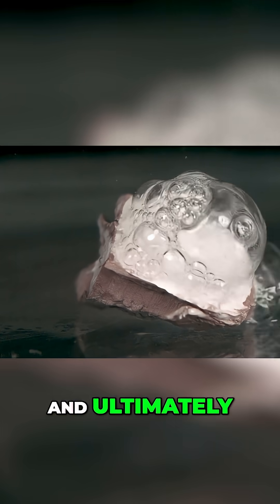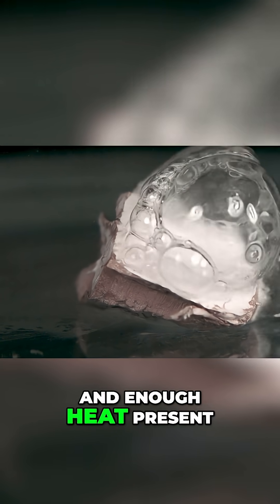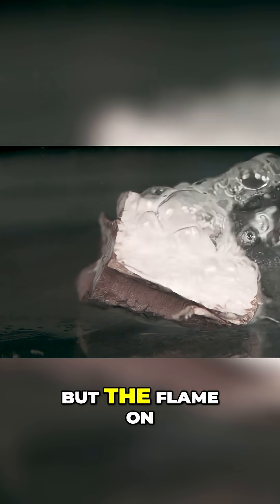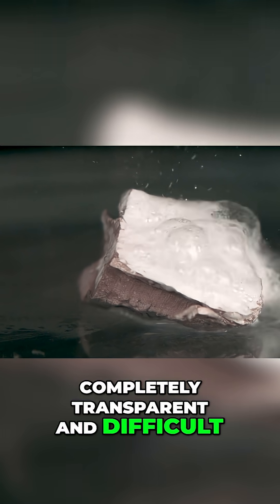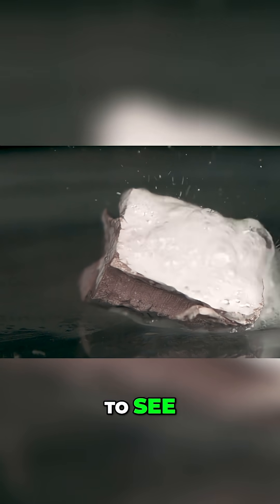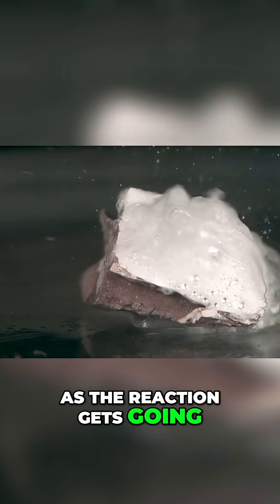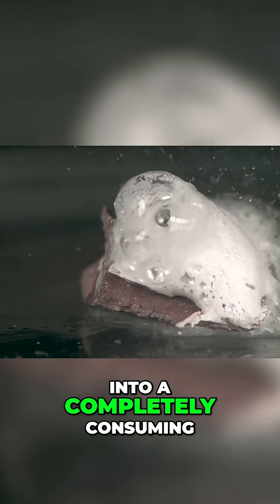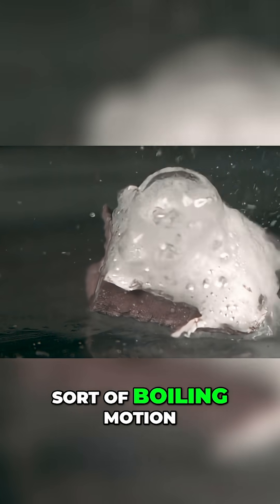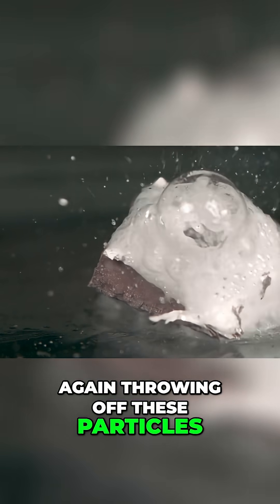And ultimately, this hydrogen will ignite if there's enough water and enough heat present. But the flame on the hydrogen is almost completely transparent and difficult to see. You can see that as the reaction gets going, first it's sort of like a gentle simmer, and then it turns into a completely consuming sort of boiling motion, again throwing off these particles.